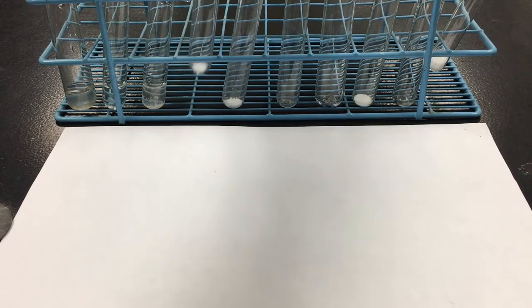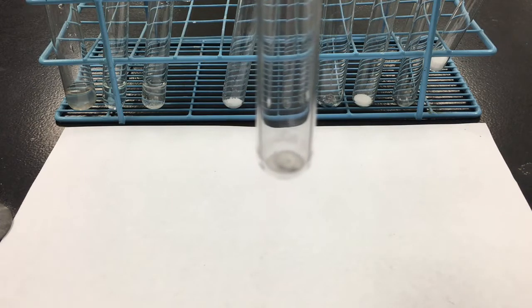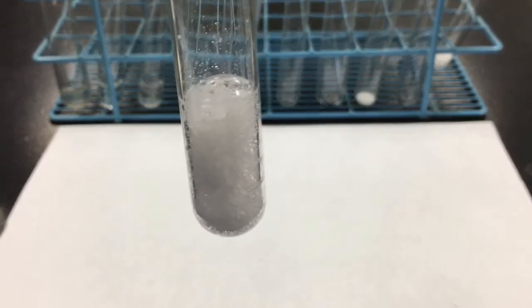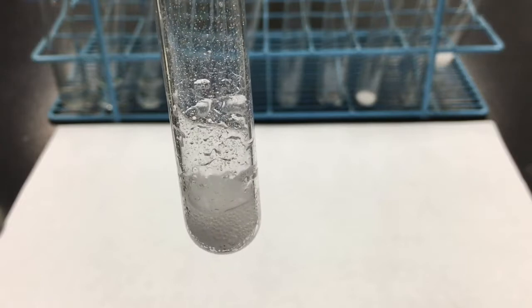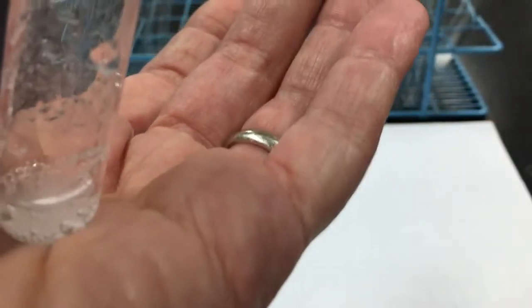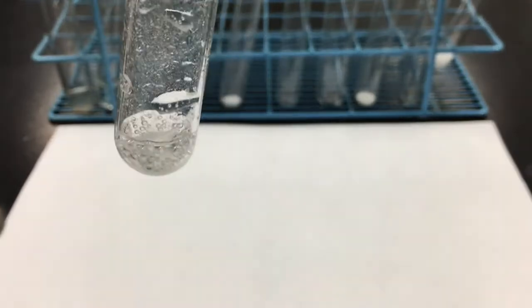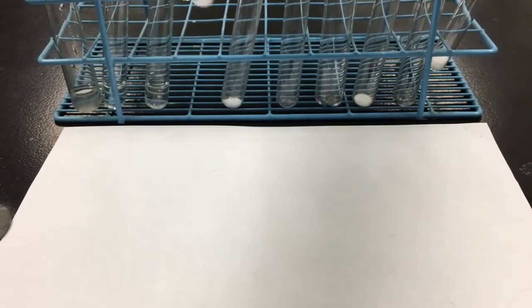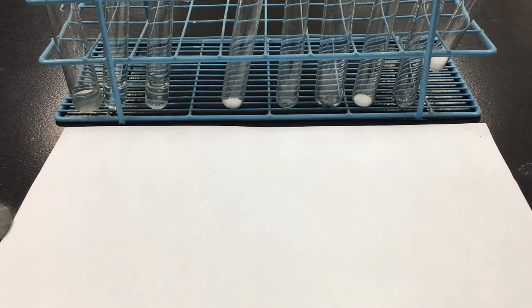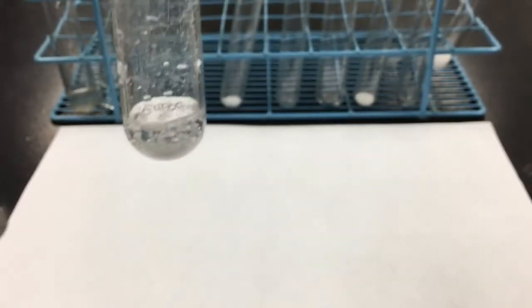Let's look at experiment number 4. Here, the solid that I've added to the test tube is solid B, and now I'm adding liquid 2 to it. I certainly heard something there. That feels colder to me than the previous test tubes, but it's hard to tell without using a thermometer. Also remember, liquid 2 was the one that I said had a strong smell, and there seems to be less smell now than there was before.